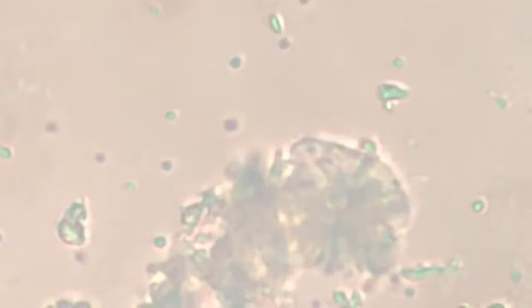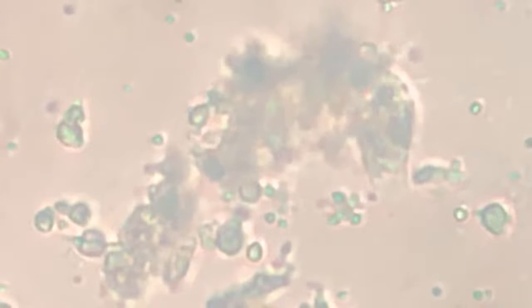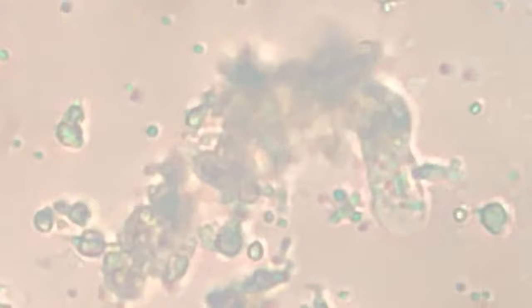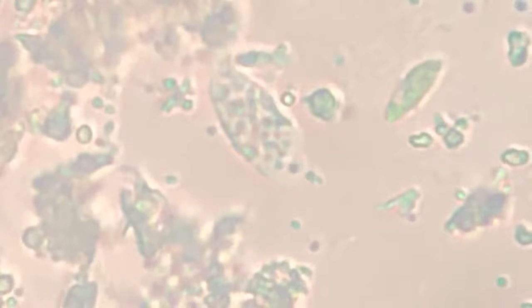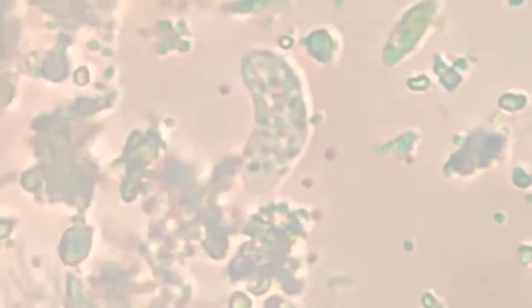Just keep doing things. Okay, now it is going under a debris of algae, a whole load of algae. He is in a whole food bucket and is coming out now. I don't know what exactly the magnification is here, but it's pretty good. 40 times at the objective, 10 times at the eyepiece, that is 400 times. Then it is magnified at least 4 or 5 times by the mobile camera. So even if it is twice, then it will be around 800x. 800x is a magnification of marvelous proportions.